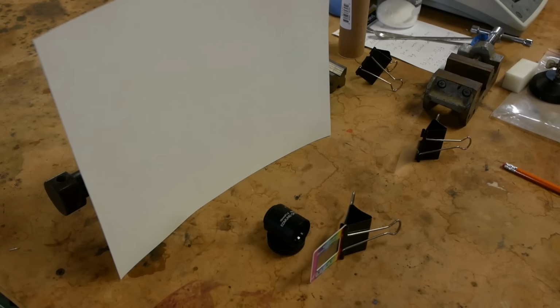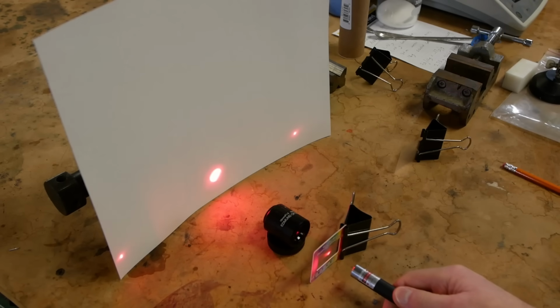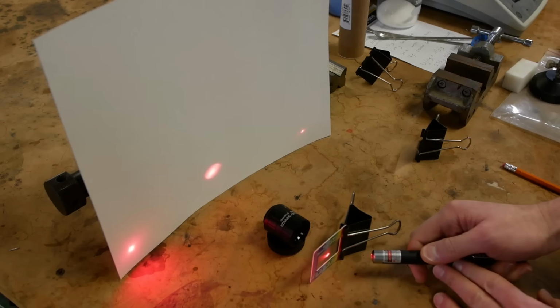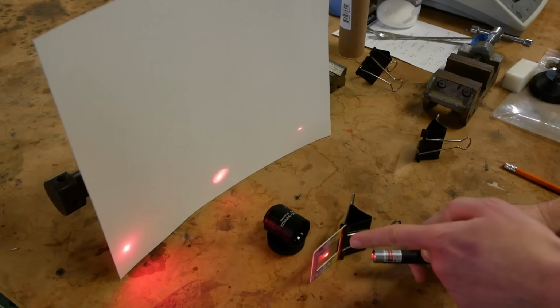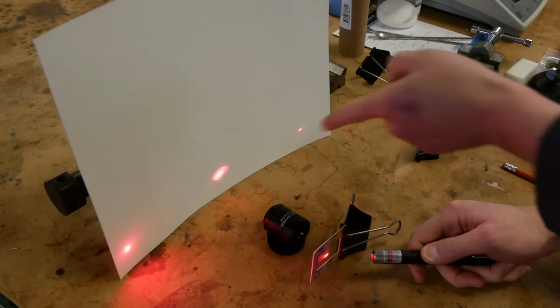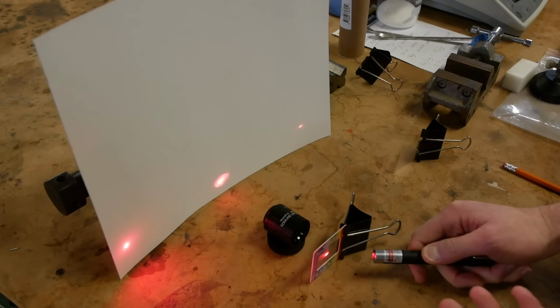Now, you might be able to guess what this technique is going to do. Remember, we're shining our beam in like this, and the diffracted light is missing our optic, so how do we get it in there? Well, what if we turned the laser pointer by a known angle? Now look what's happening. The primary beam is missing our lens, but the diffracted beam is going right into it and getting focused down. Quite clever, isn't it?